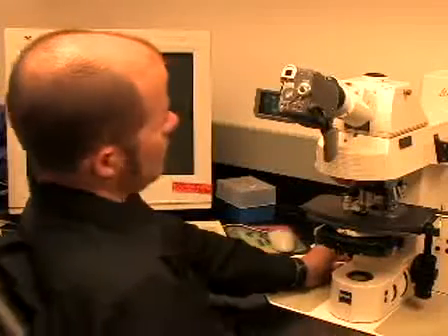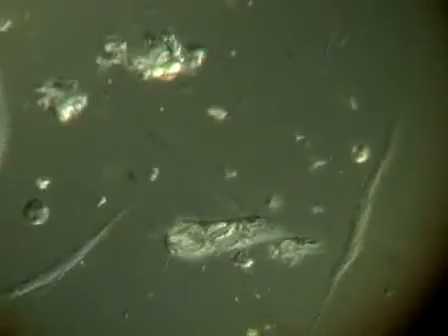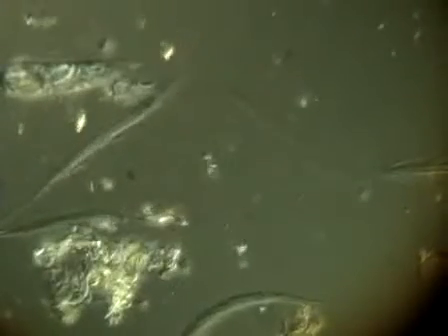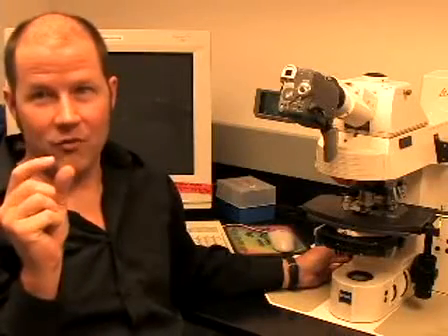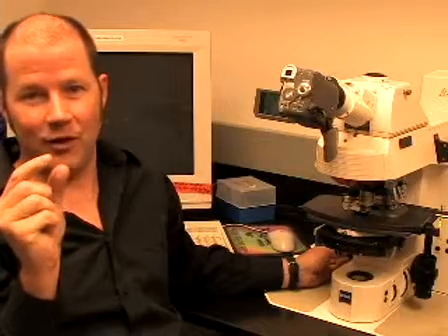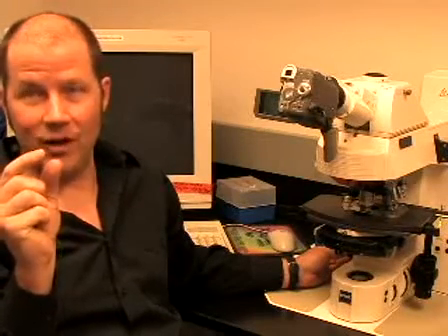I'm just going to look at this protozoan here. There are 2 or 3 of them here. They're these long, slender protozoa that look as if they're striped, and you really see that with the DIC when you look at them. I always say they're fascist protozoa. And what do I mean by that? The Latin term fasces describes the bundle of sticks on the back of a dime, and it also describes e pluribus unum. You know, in many there's one.